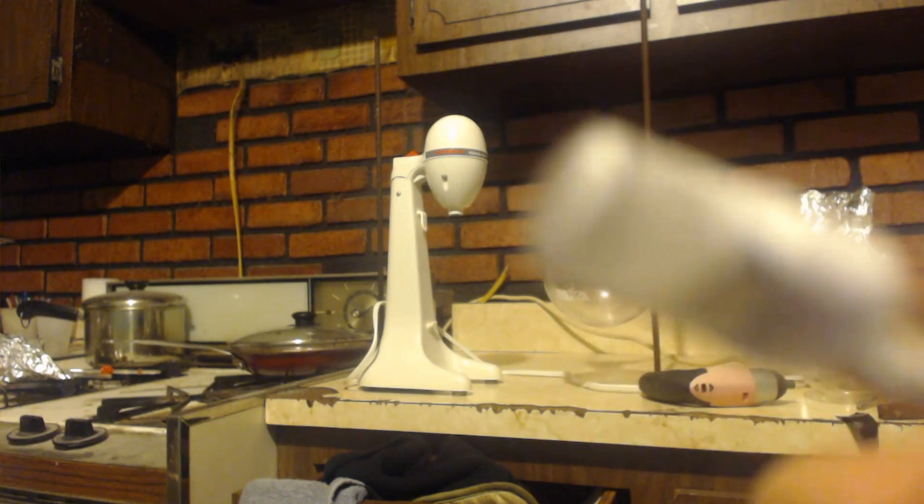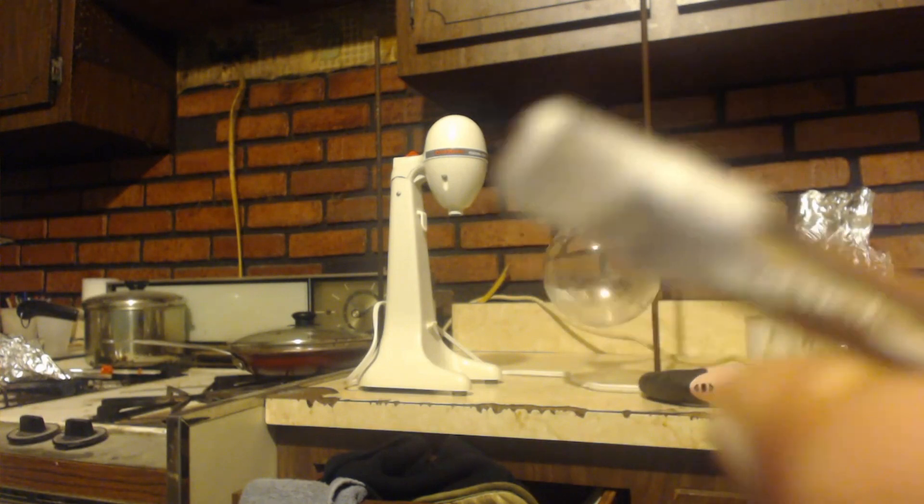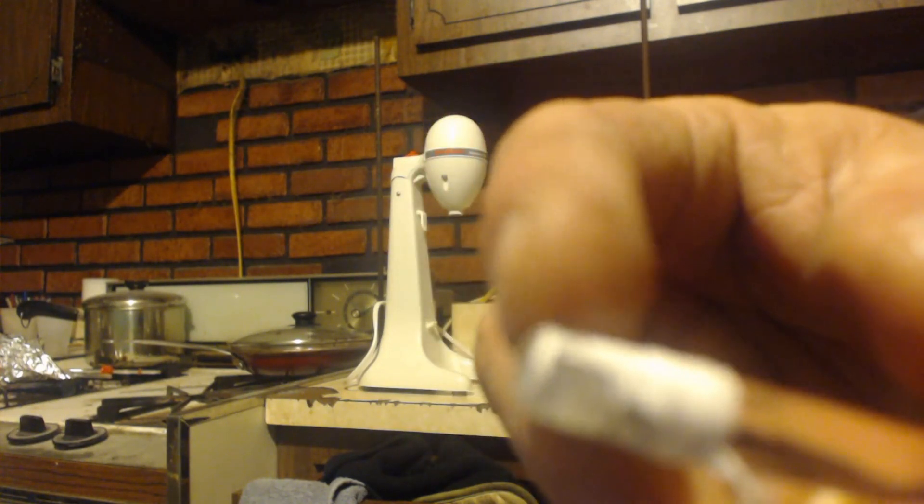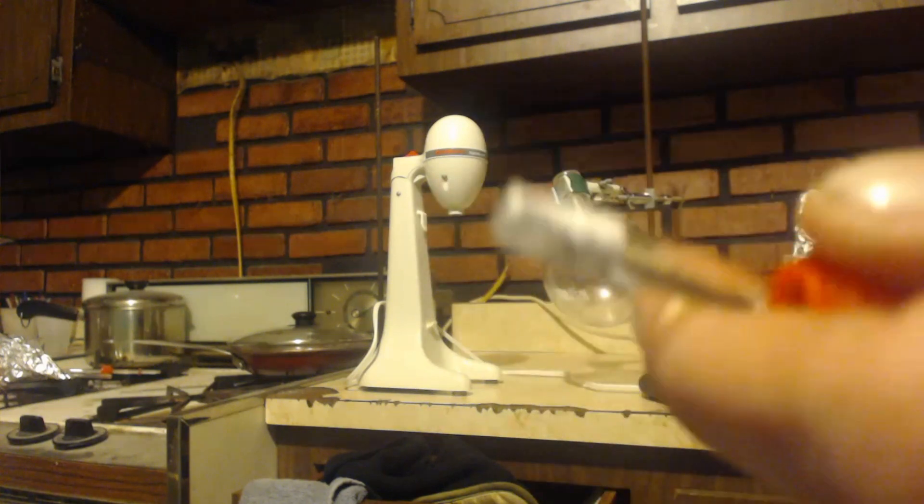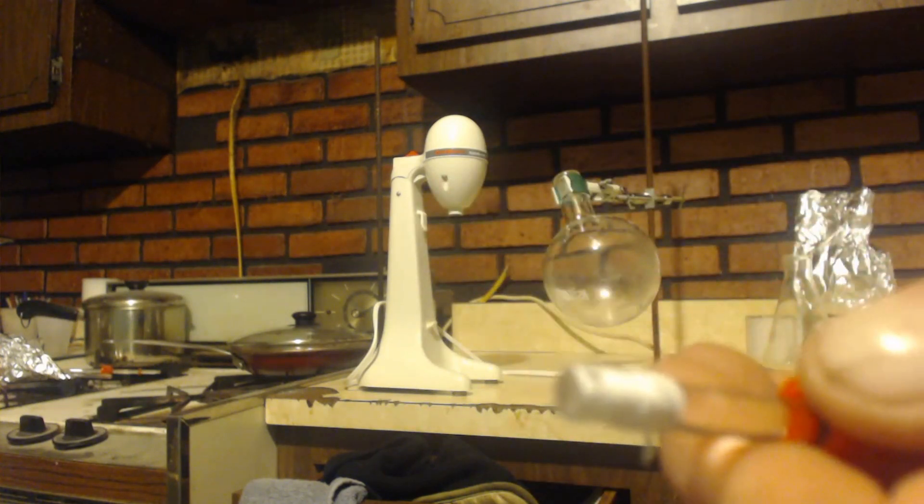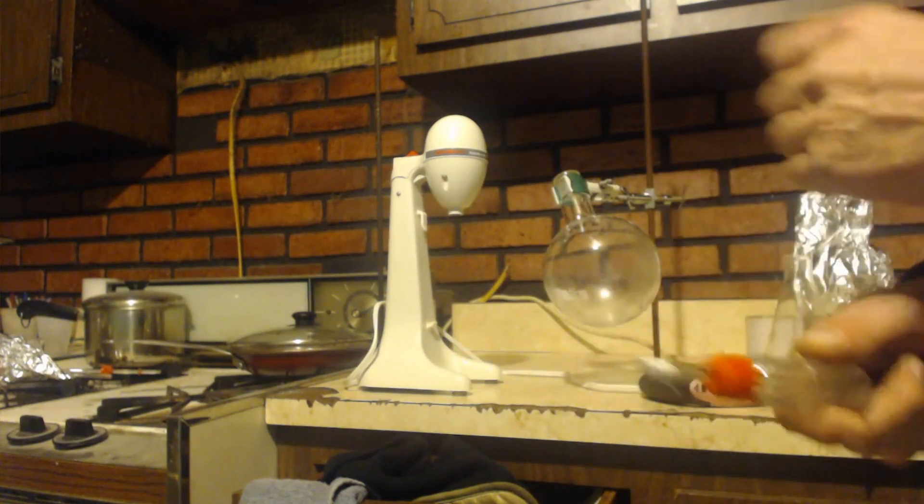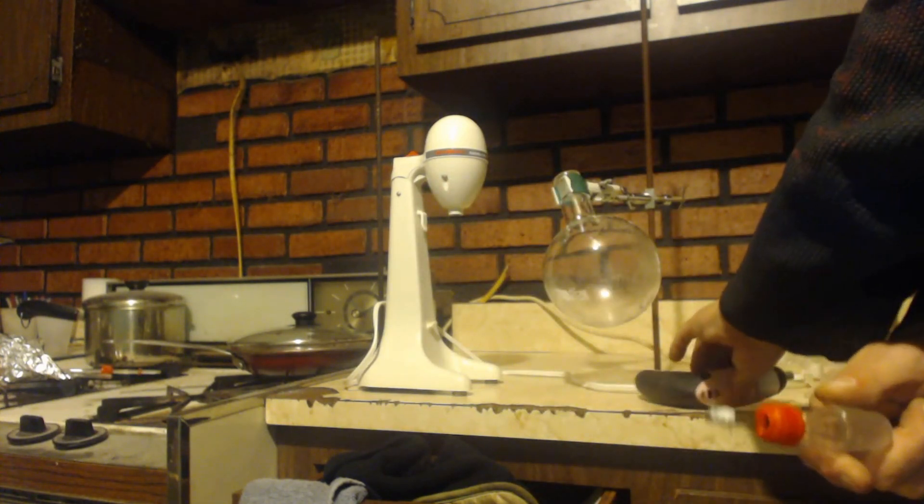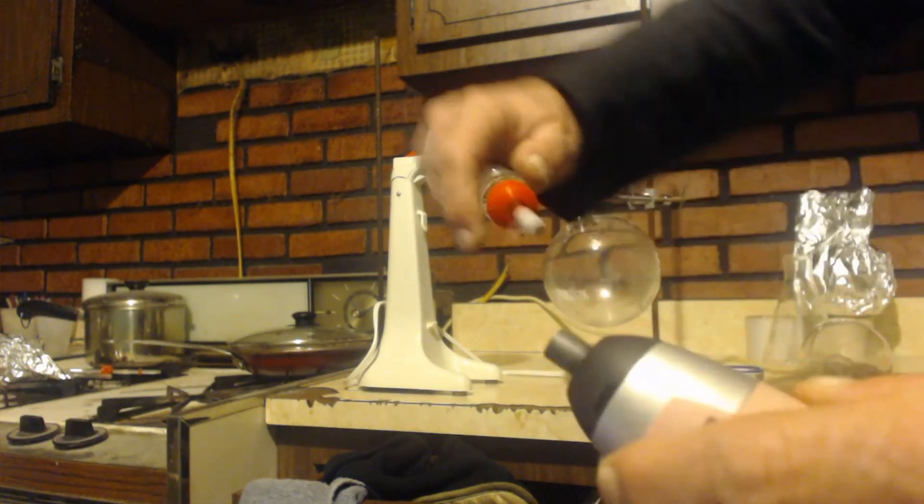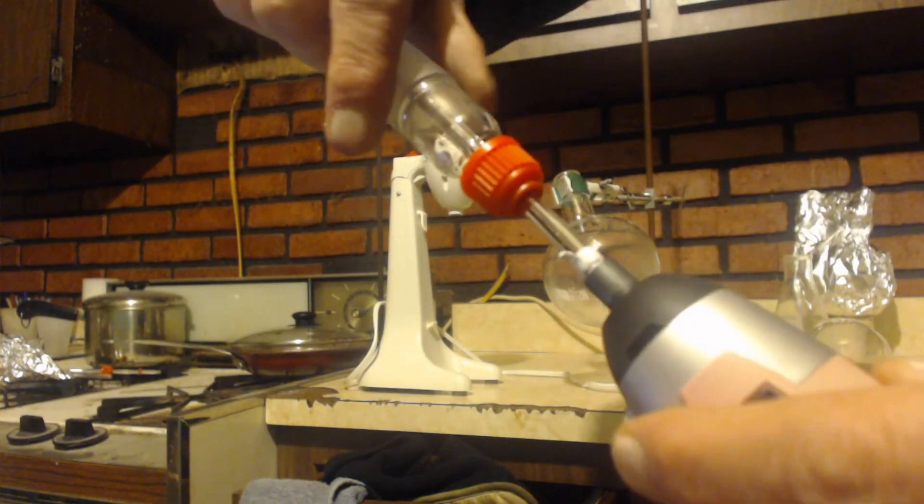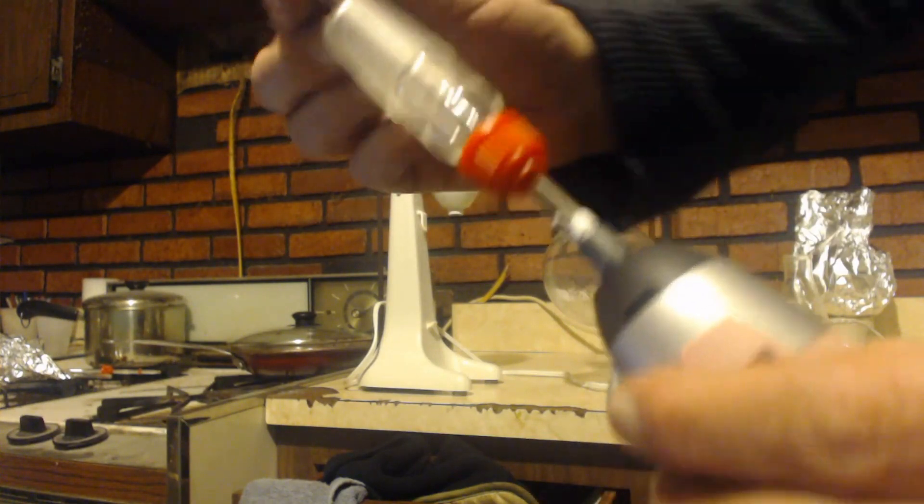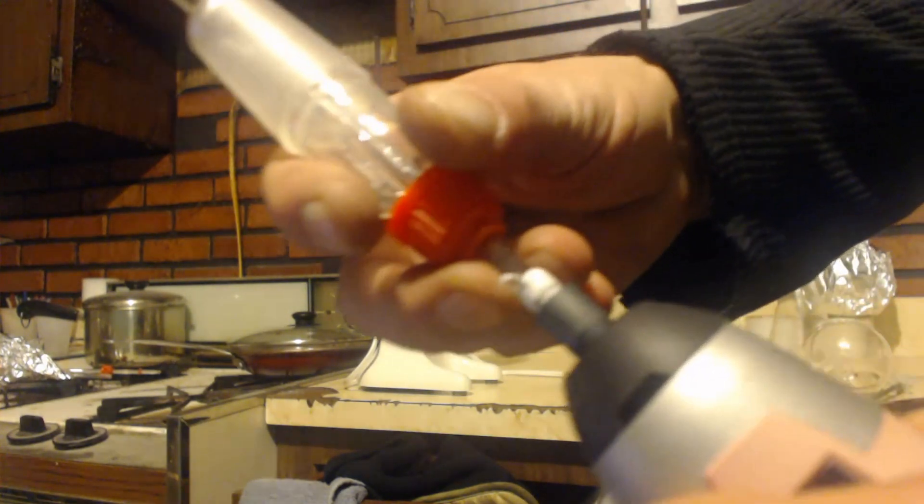I don't know if you can see it, but this part up here, the first four or five millimeters is hexagonal now, even though it was round to begin with. Because what I did was I just smashed it in there until it went into it and it kind of made it into a hex, a hexagonal type thing.